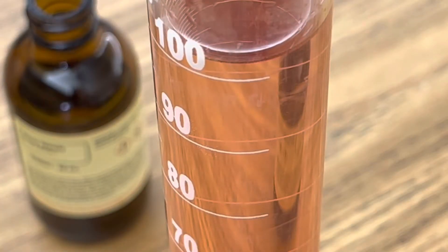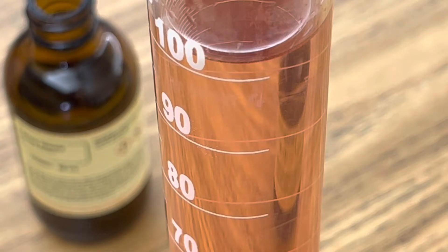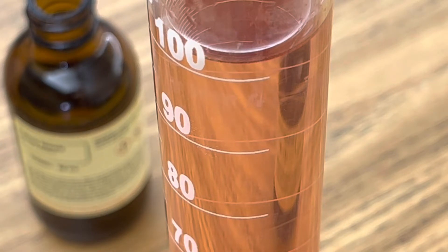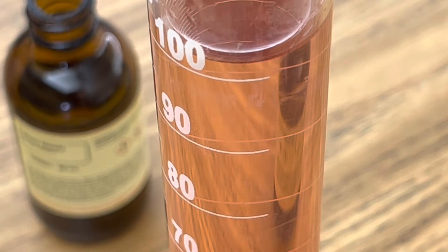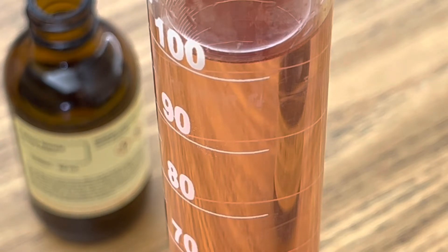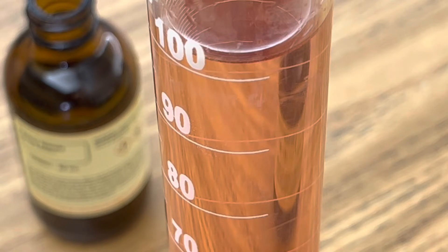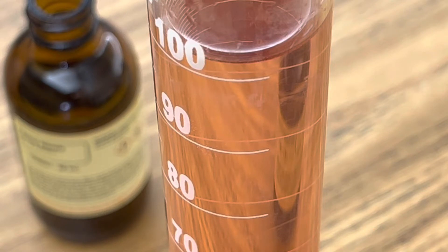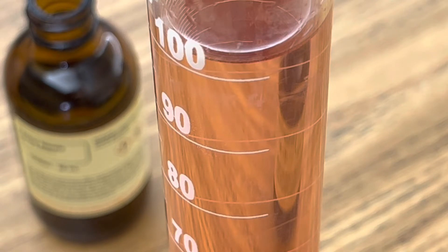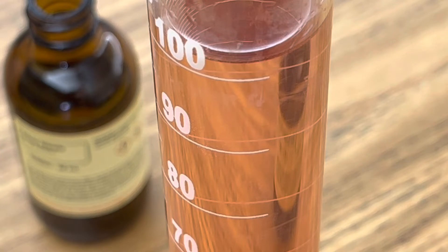Once your solution of cobalt chloride is completely aqueous, you're ready to start adding drops of silver nitrate to observe the double displacement precipitation reaction, where your silver nitrate precipitates out of the solution as silver chloride.